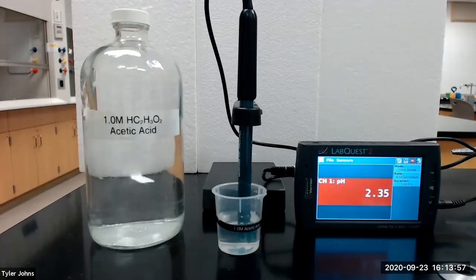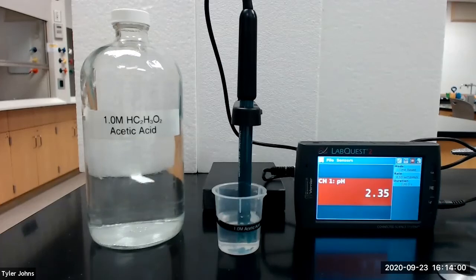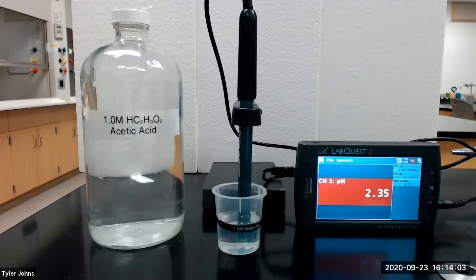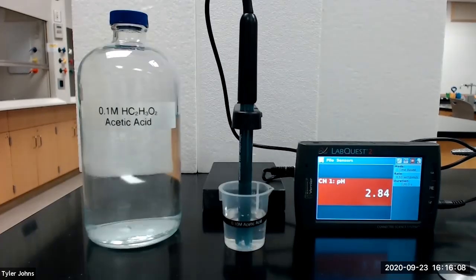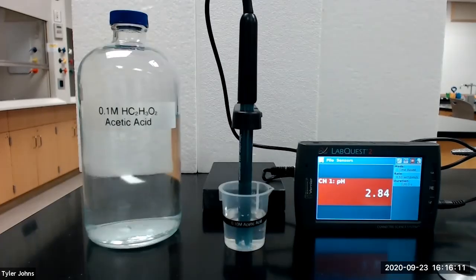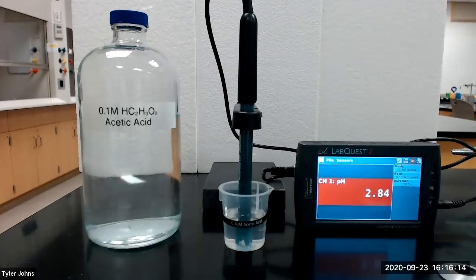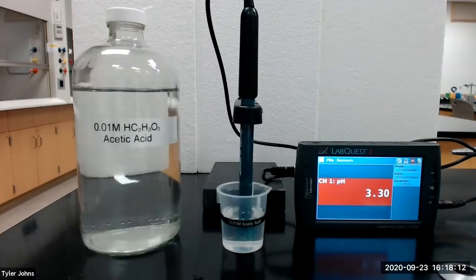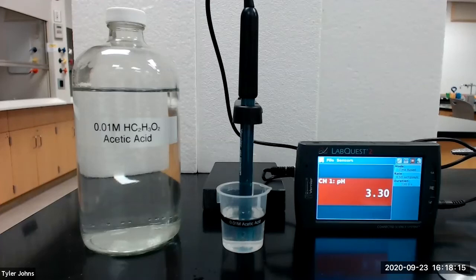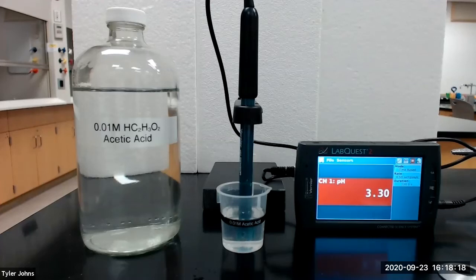Our next solution is 1.0 molar acetic acid, which has a pH of 2.35. Our next solution is 0.1 molar acetic acid, which has a pH of 2.84. Our next solution is 0.01 molar acetic acid, which has a pH of 3.30.